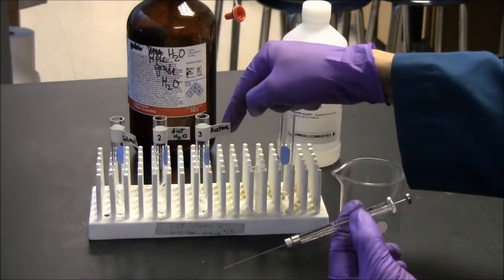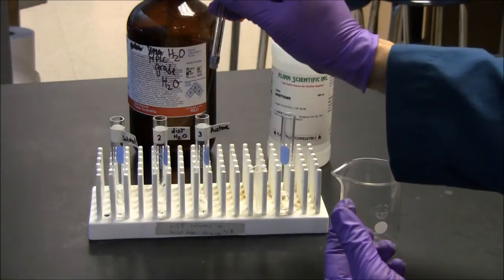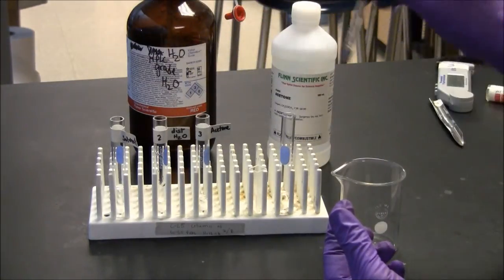The last recommended rinse is acetone. We have some reagent grade acetone here. That's the last rinse of the syringe.